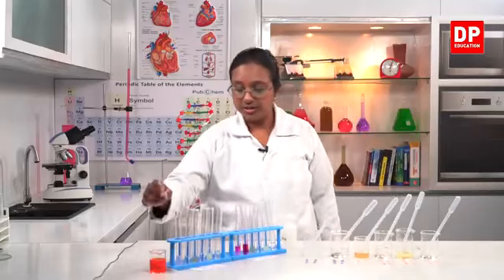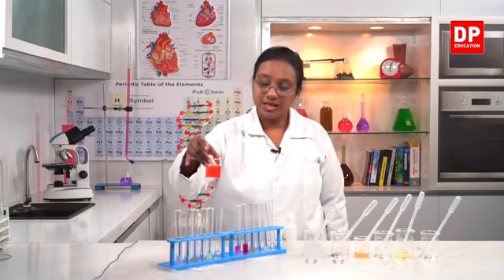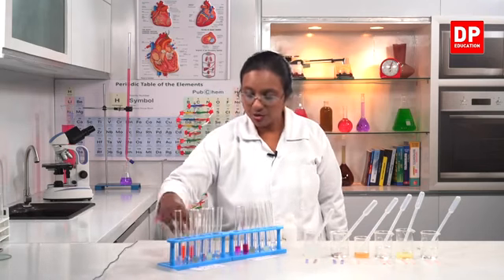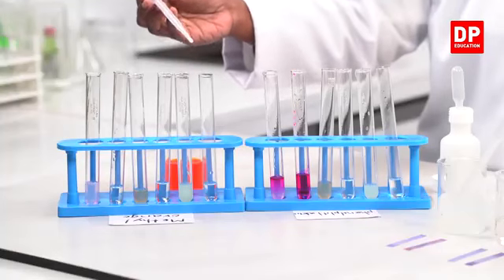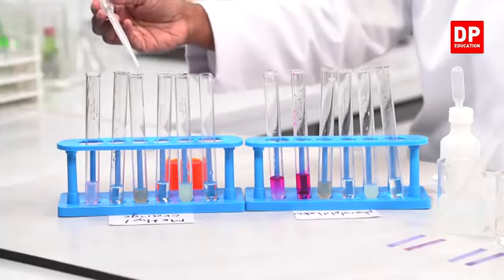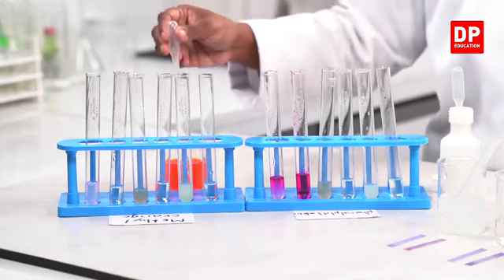So similar to these students, I told you all about the methyl orange indicator. You can see the color itself is methyl orange. So I am going to add few drops of methyl orange to the same solutions. Dilute hydrochloric acid, lime juice, dilute sulfuric acid, vinegar, dilute sodium hydroxide, and soap. Right.